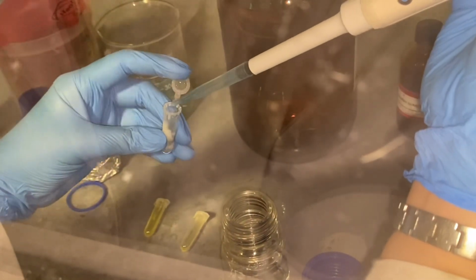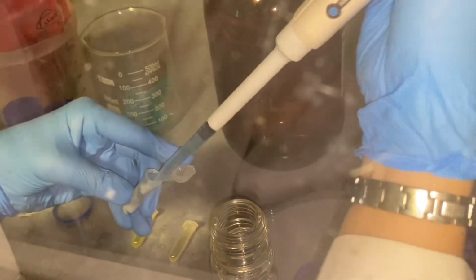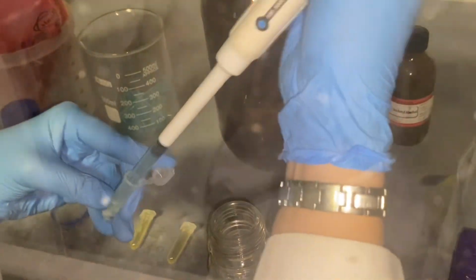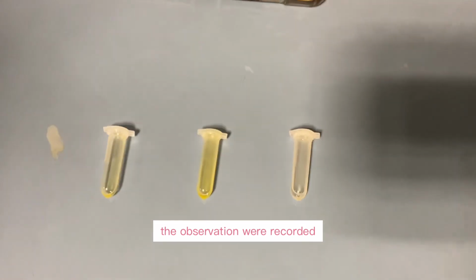We also used the pipette tips to mix the lipids and the toluene, so the process will be much better and easier. The observations of the mixture were recorded.